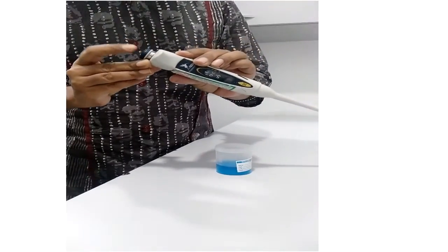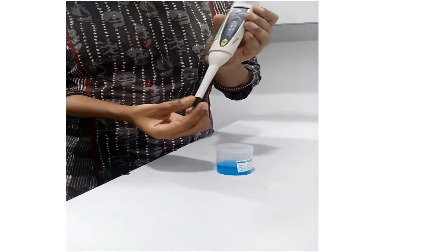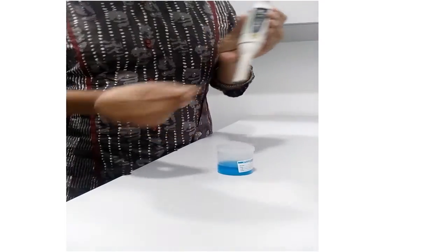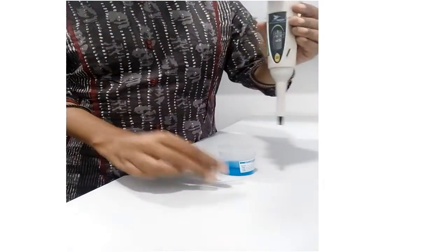And by pressing the plunger or rotating it, we can serve the actions of the plunger. Now, let us check how to aspirate the volume using this micropipette.